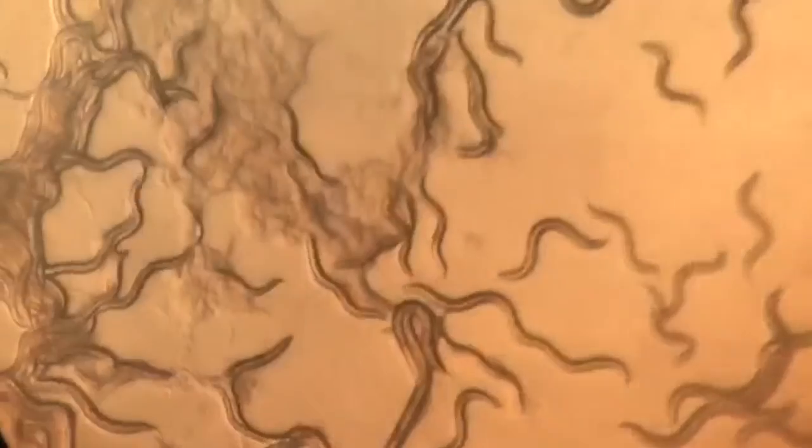In this lab, we use the RNAi system plus gene silencing to change and manipulate a worm's morphology. On the first day of lab, we received wild-type C. elegans that we would observe in their natural state. As you can see, they move in an S shape throughout the plate.